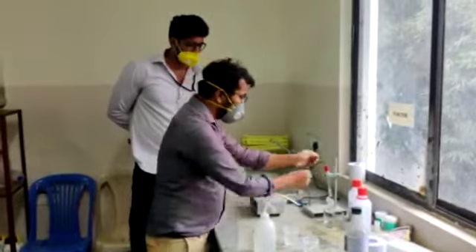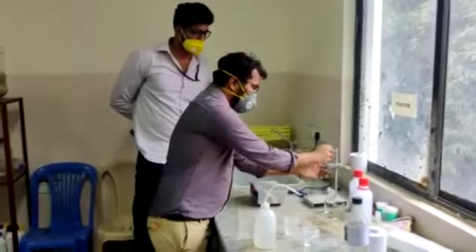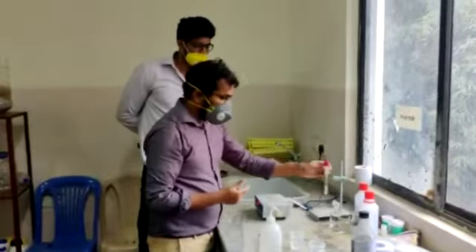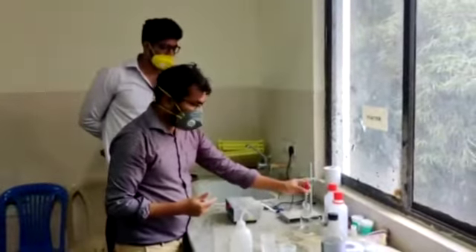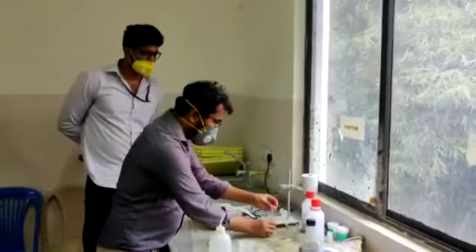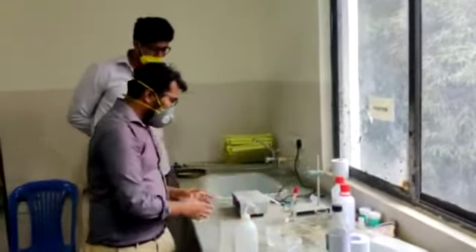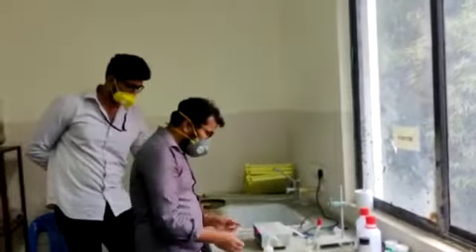Then this is what we call as electrode. This is the electrode. We have to just dip it here. When you dip it here, you have to calibrate it first. When you dip it here, you have to adjust here.